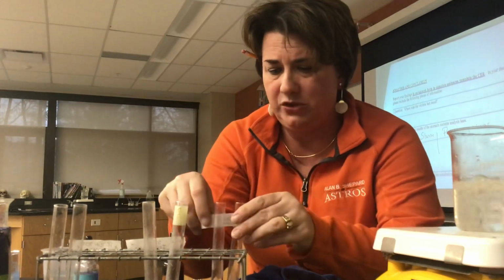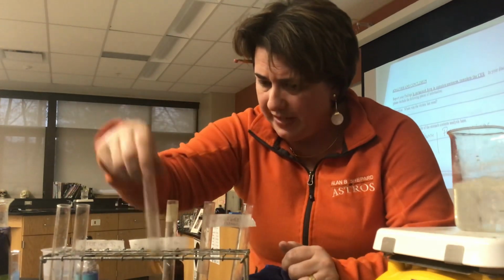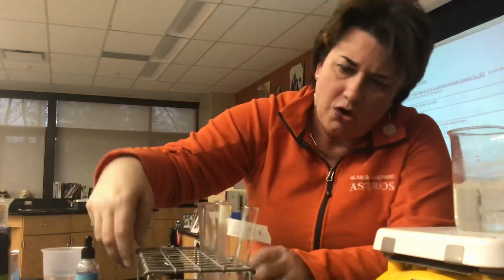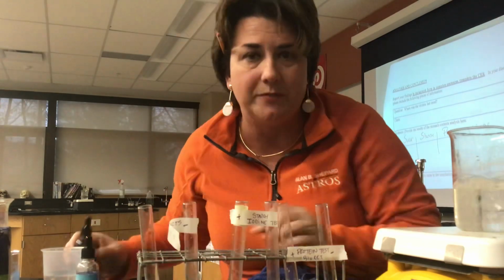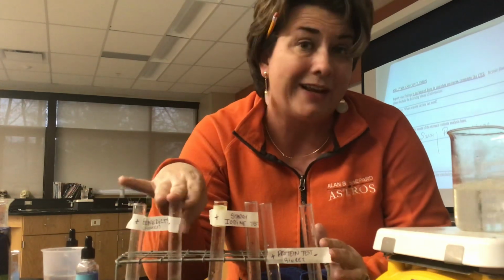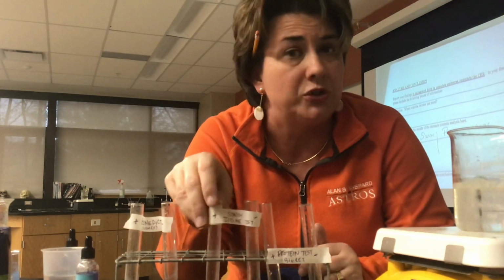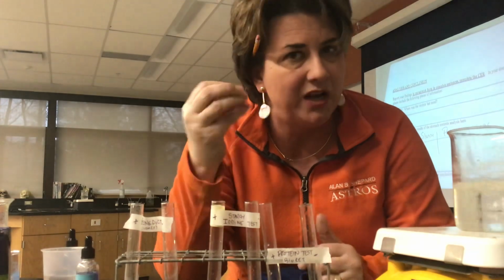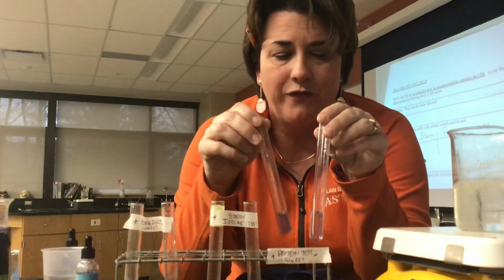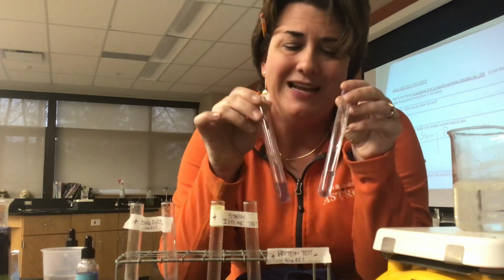So just to kind of show these to you one more time, let me make sure this looks good. So I've got a couple of labels here for you to take a quick look at. What I have, just so I can show you all of them side by side, is my Benedict's, which tests for sugar. A positive reaction is an orangish red color, a negative is blue. So again, when a sugar is present, it will change to that red-orange color. When a starch is present, it will turn black in the presence of iodine, and it will remain kind of a goldish orange color in the absence of a starch. And with protein, we're going to get kind of a pink color when we have protein present, and it will remain blue, which again is the same color as the Biuret, in the absence of a protein.